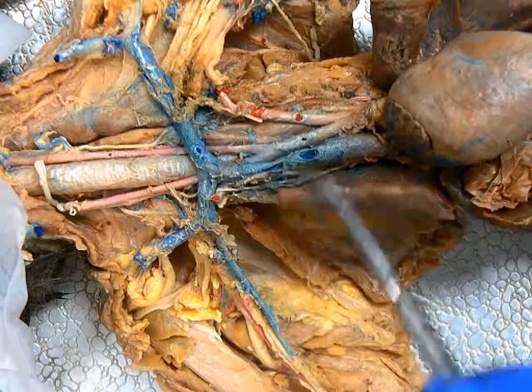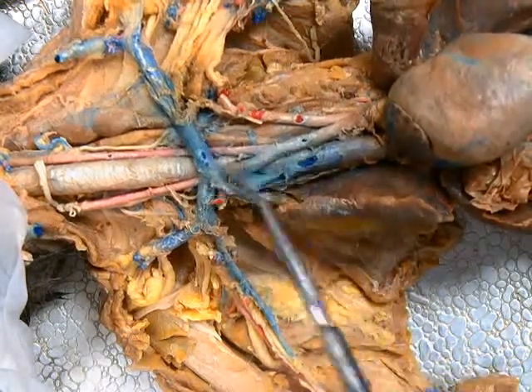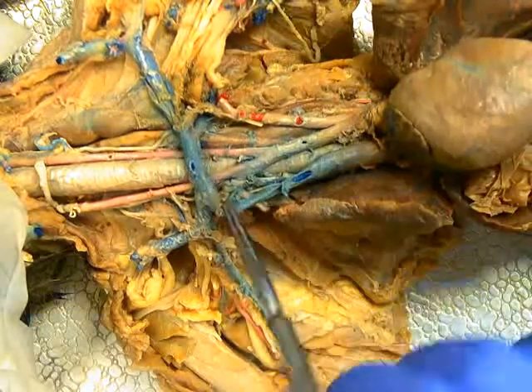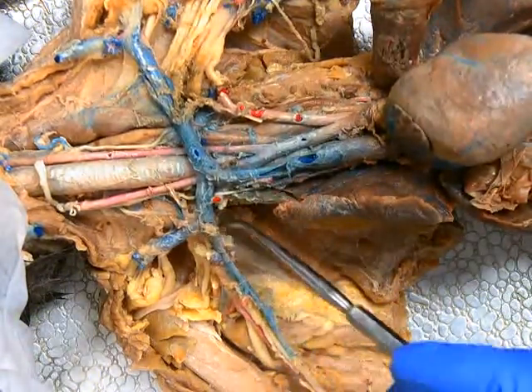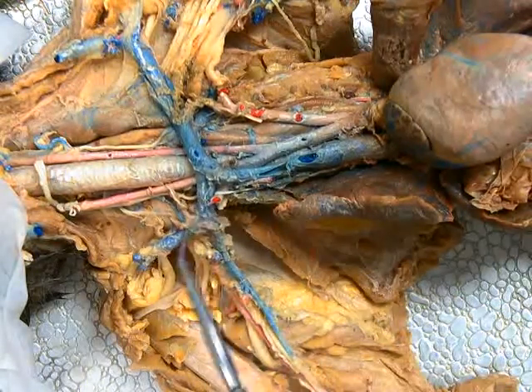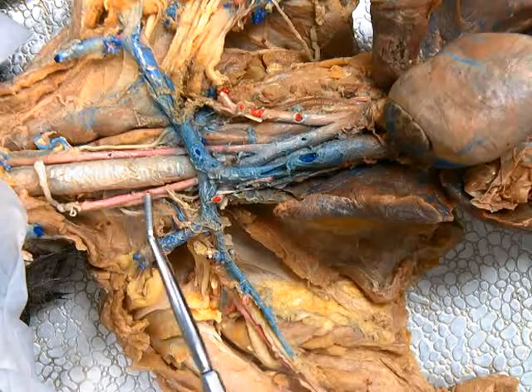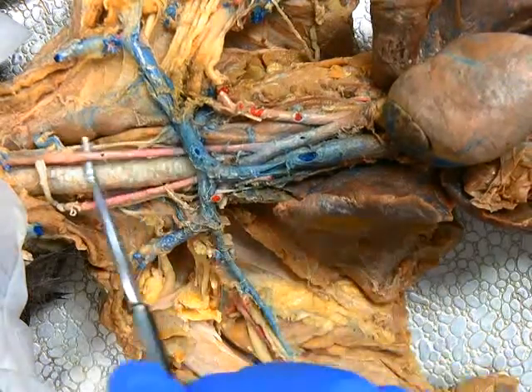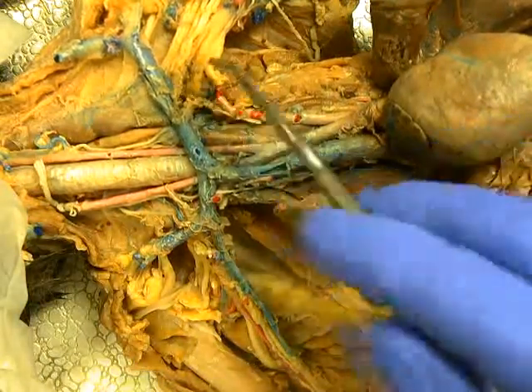The branches of the aorta are a little different in cats and pigs, so we're going to test those from the model. You'll see here the two branches: the first one becomes the right subclavian artery hiding beneath this vein here, and then we'll have the right common carotid artery. The next branch will be the left common carotid artery, and then the final branch will become the left subclavian artery.